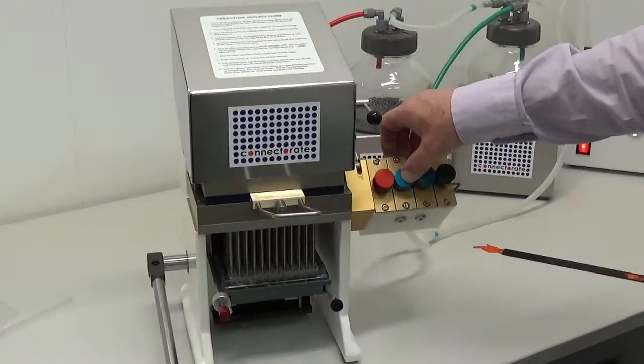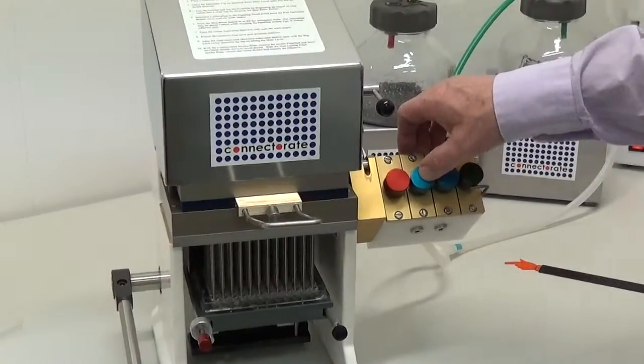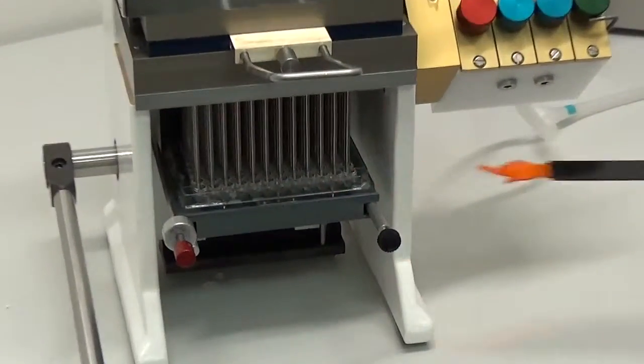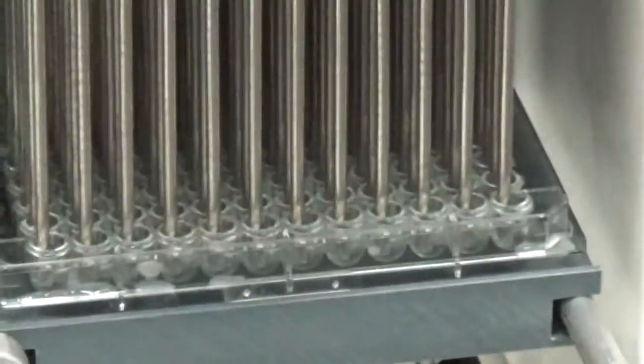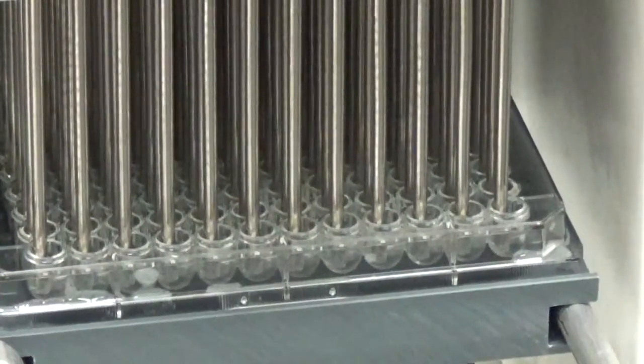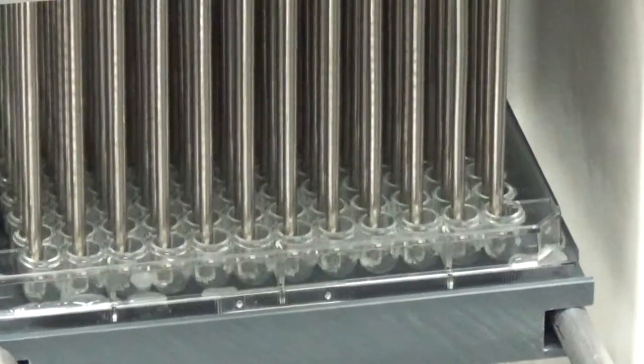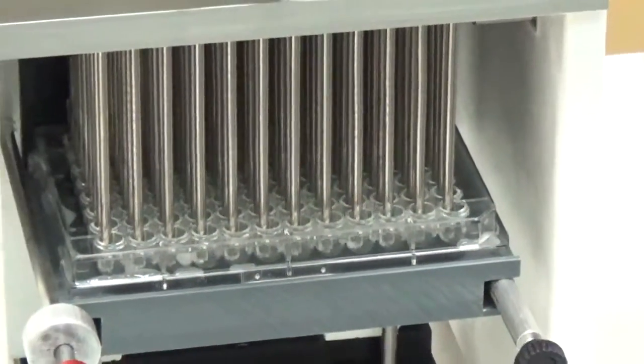Activation of the blue button will dispense water into each well. It can be removed again by activation of the red button.